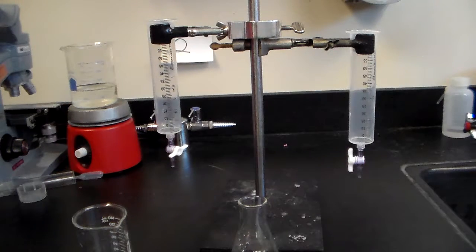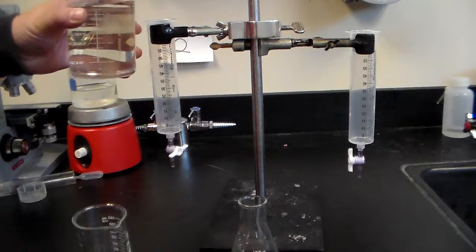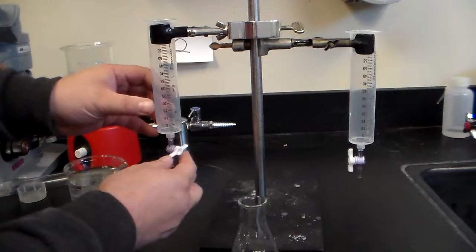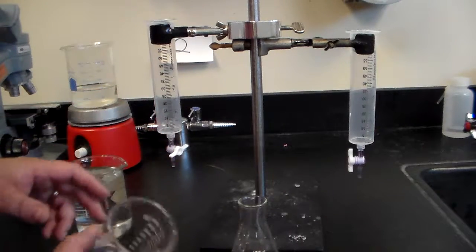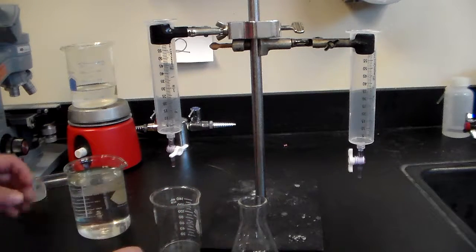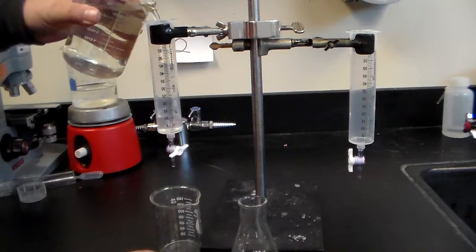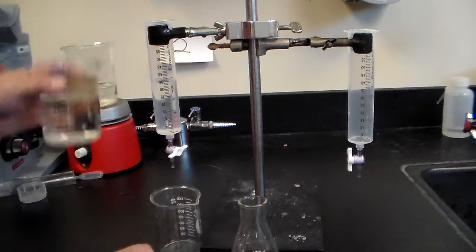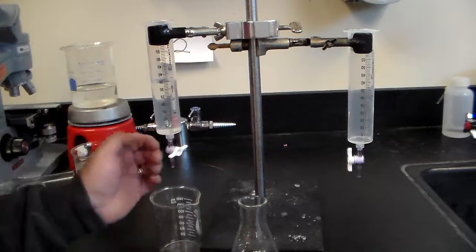You're going to get a certain amount of acid, and then you're going to make sure that this is closed off. This is the position where this is closed because this is the valve of the burette. This is our trash beaker. We can put that underneath here and we're going to fill this up. In the lab, you're not going to fill it all the way up.